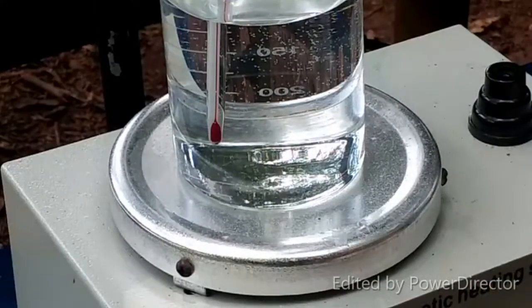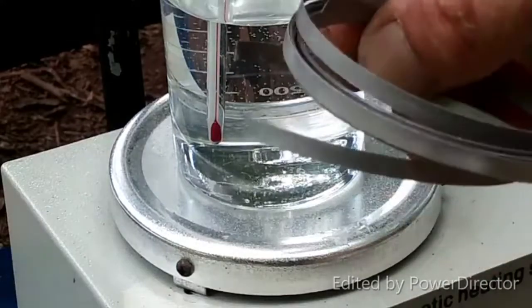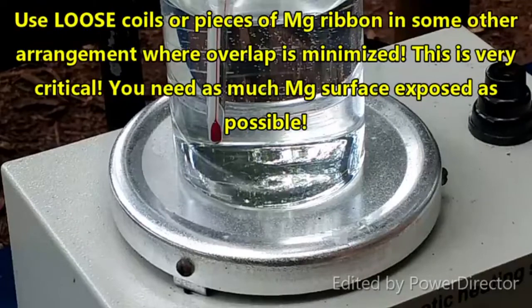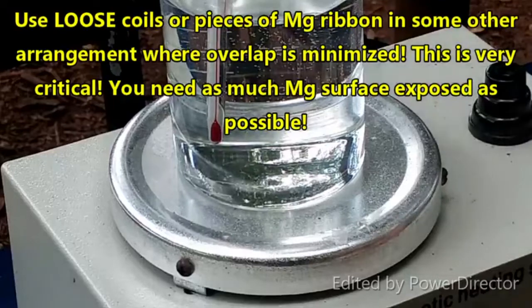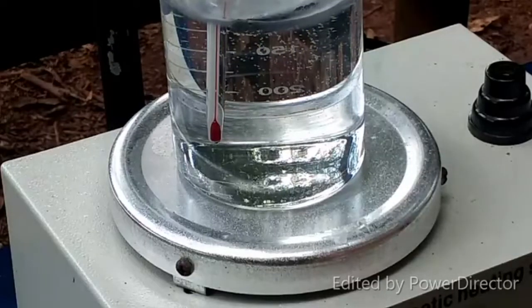The solution is at about the right temperature — just under 50 degrees C. What I'm going to do now is add some coils of magnesium ribbon. We need to use three and a half grams of this stuff, and we are going to add it in here in order to create lead sponge. The lead sponge has to be freshly prepared; you can't use powdered lead, and it has to be done without stirring.